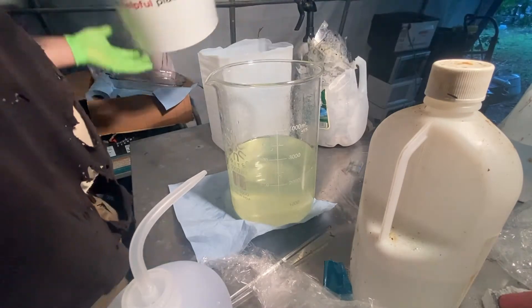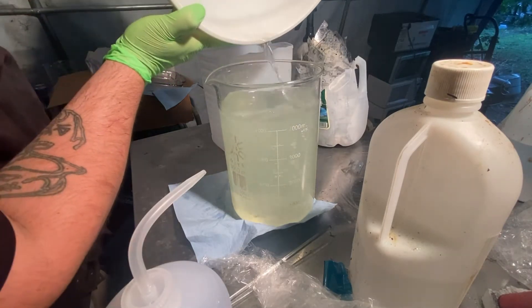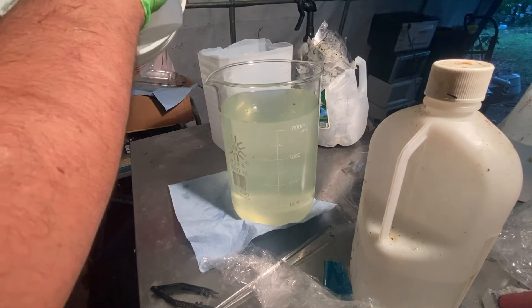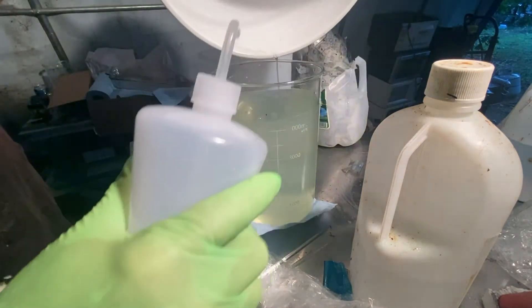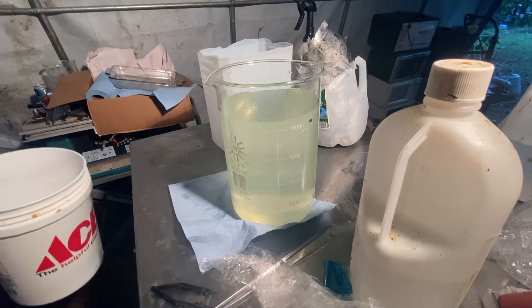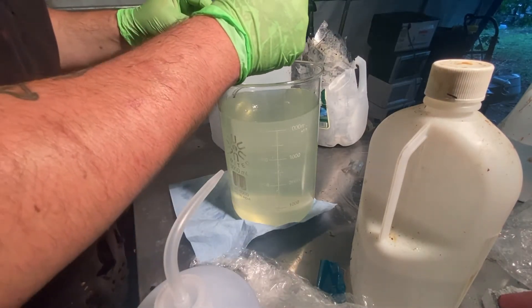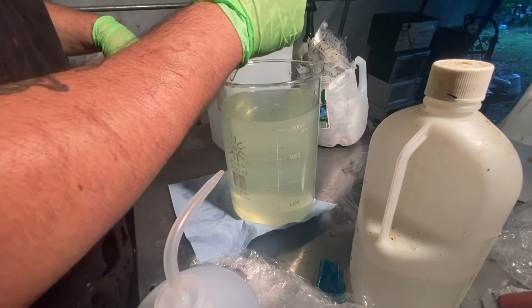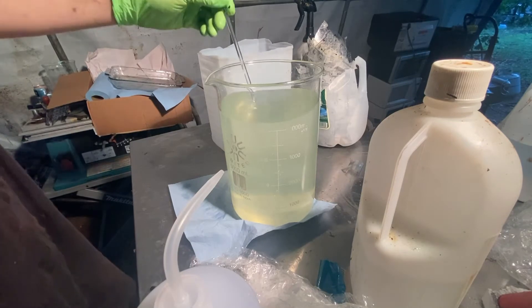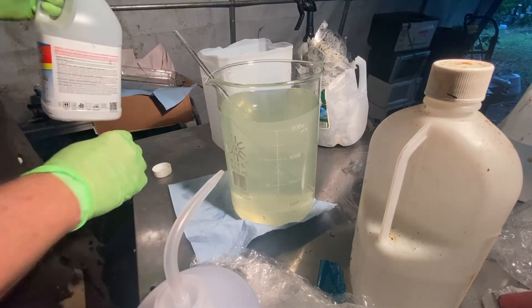And this was my final five-gallon bucket rinse with the mylars. It's okay to have it a little dirty — we're going to filter everything. Now we're going to add some hydrochloric acid — muriatic acid — to precipitate the silver.